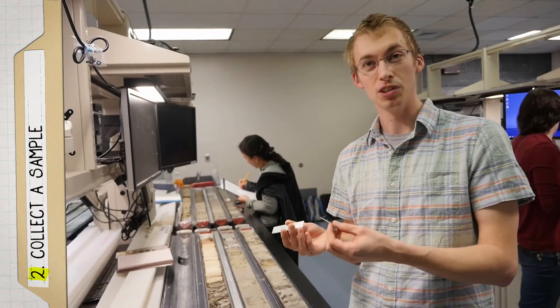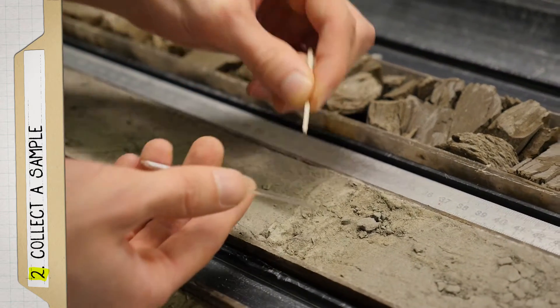For step two, you take your labeled slide and a toothpick and you collect sediment from the horizon that you're interested in.